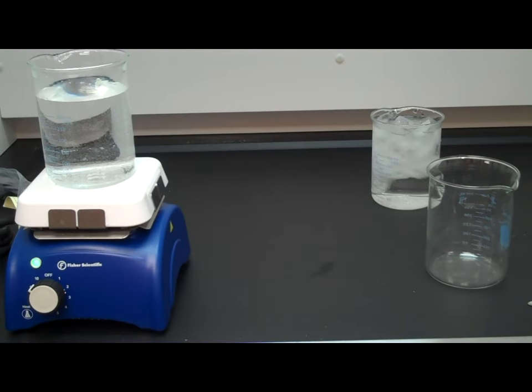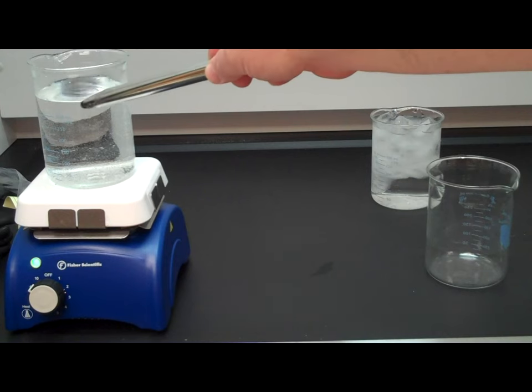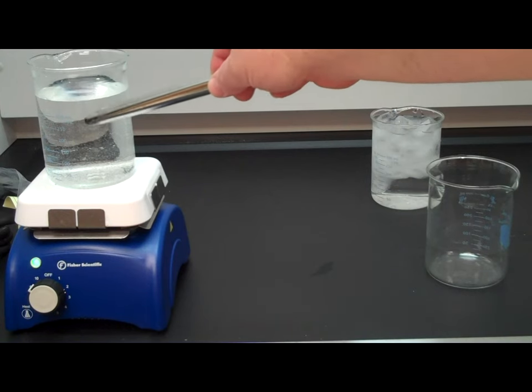This is a quick little demonstration I do to demonstrate the effect temperature has on the rate of diffusion. And as you can see, right now I have water that is on the hot plate that is coming to a boil.